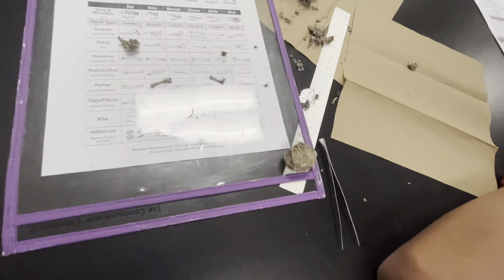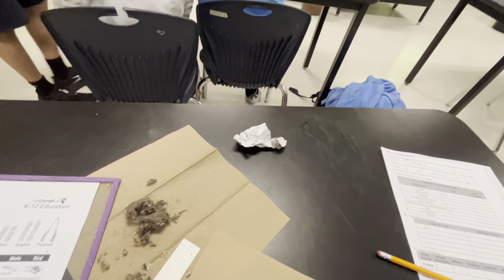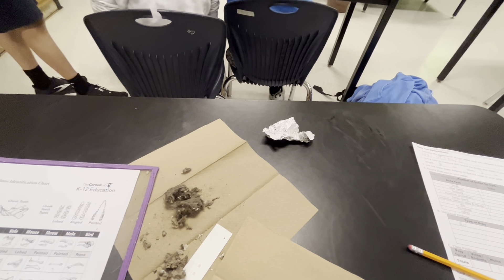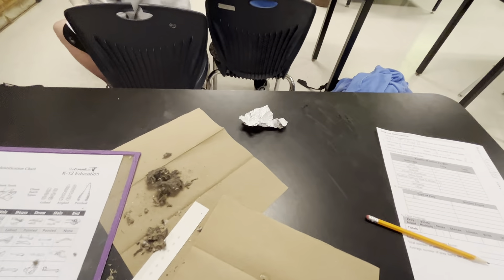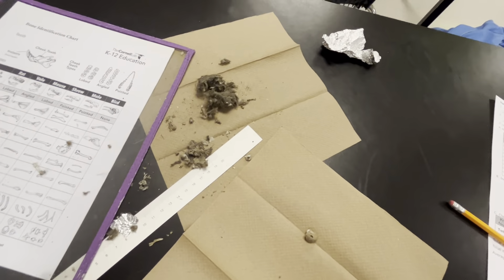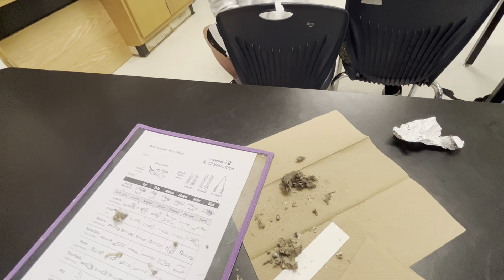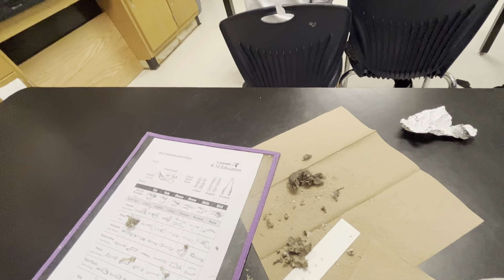Mouse rib! Chase, do your work. This is tough. Alright, I'm gonna hold this up and you put that one in here. I wanna keep this one. Sir, can we get another one? No. Not everything in this world can be purchased. Happiness can be purchased? No. Trace, say hi to the video.